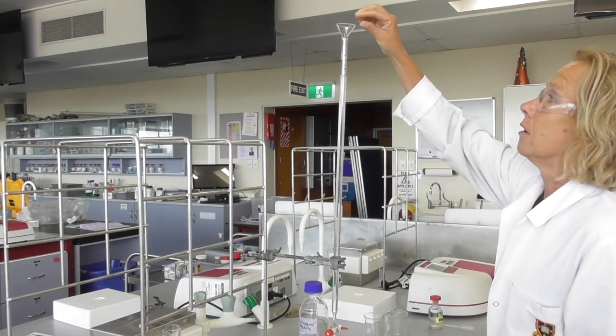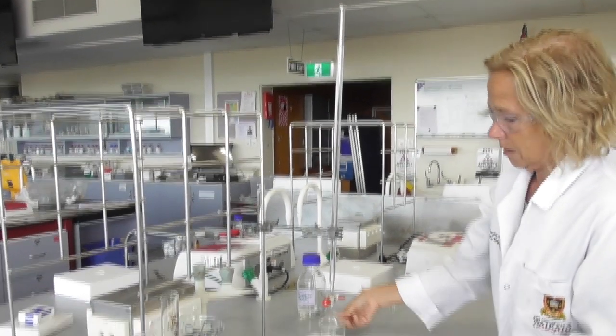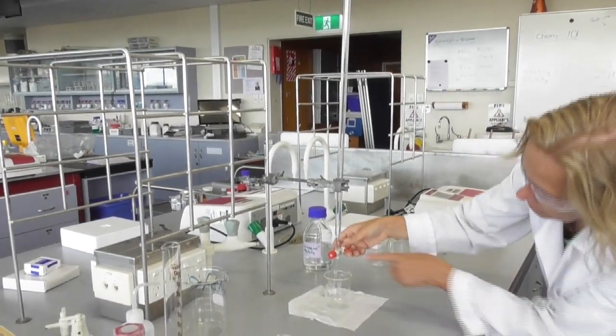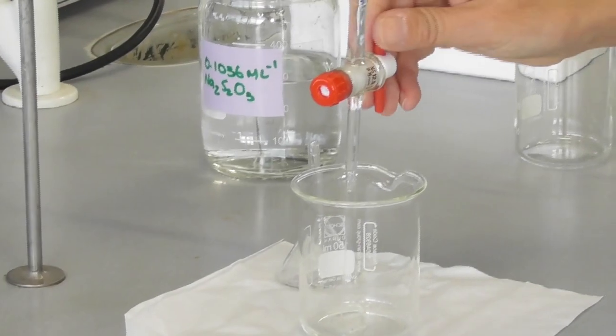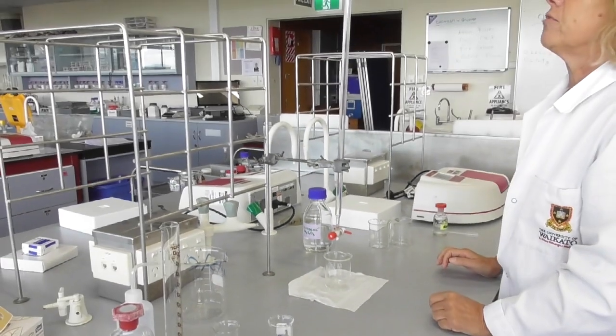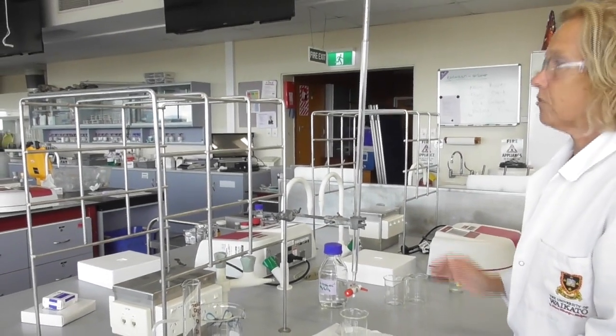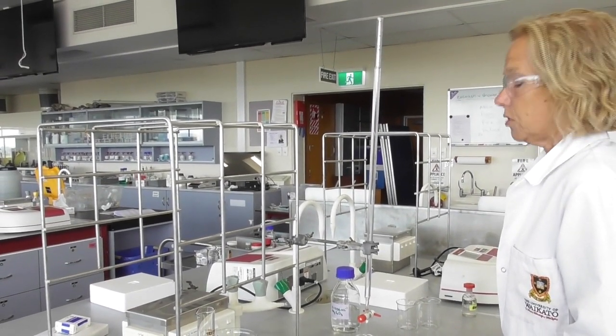Once I filled it fairly high, I take out the funnel from the top. I drain some of the solution into the waste beaker to remove any bubbles from the bottom of the burette. Now I'm ready to start, so I take the initial reading of the volume.